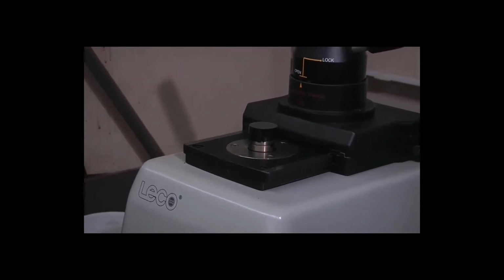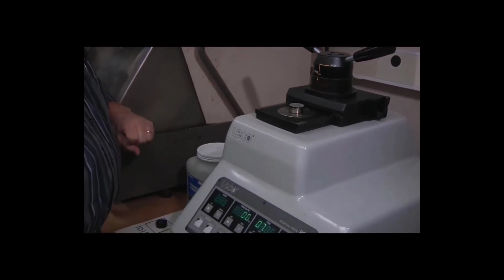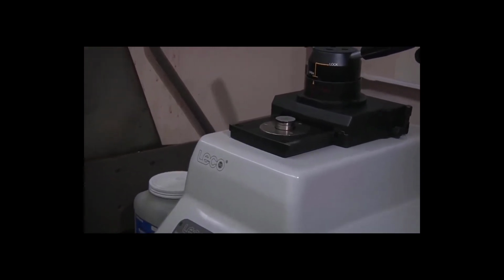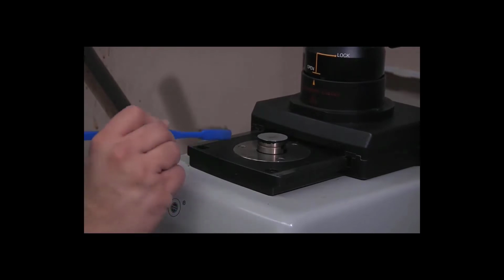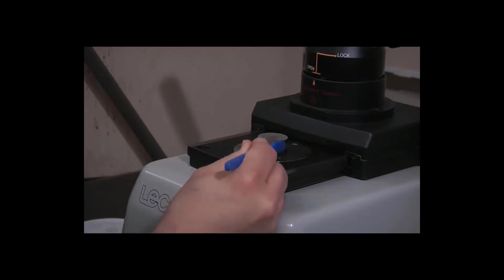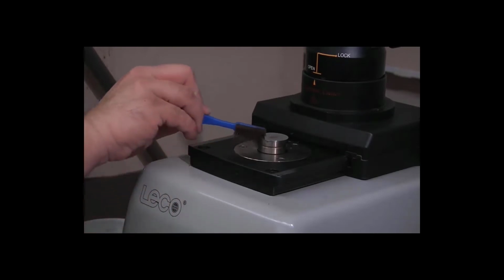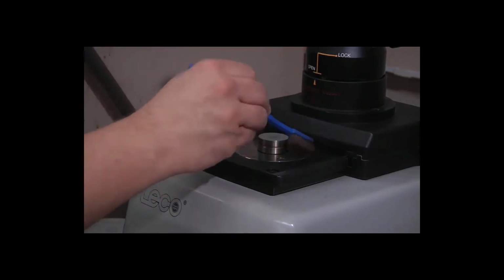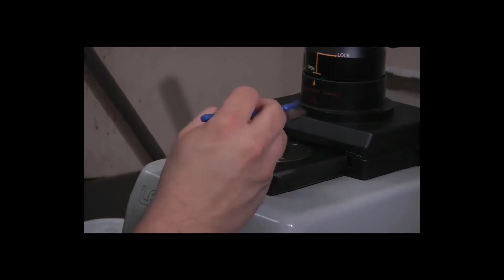So 50 degrees C is fairly warm, but safe enough to touch for a moment or so. And you can see now we have a fair bit of flash around the edge of the ram. So I'm going to start with this toothbrush and just try to scrape off, and you can see it's flaking off pretty easily here. Sometimes it comes off very easily with the toothbrush. Sometimes you have to resort to scraping it with the edge of an X-Acto knife. So we brush away that flash.